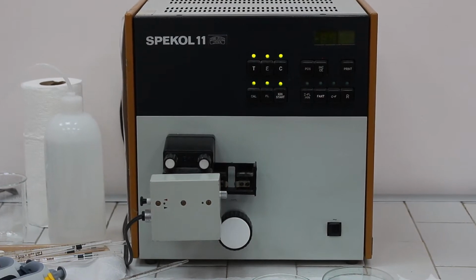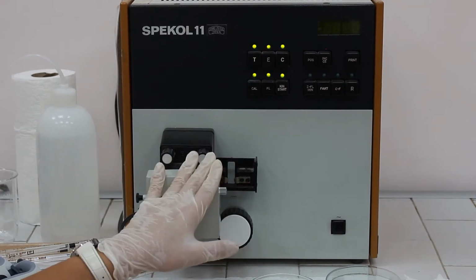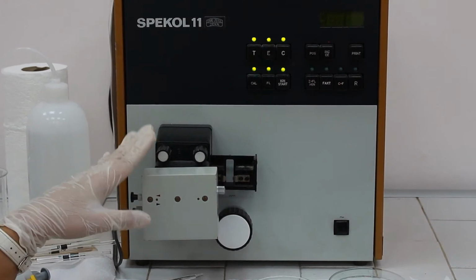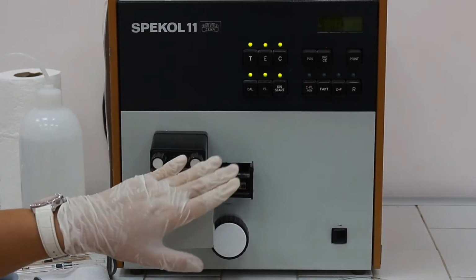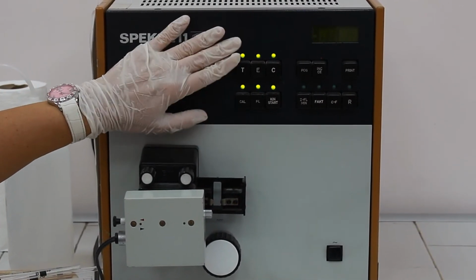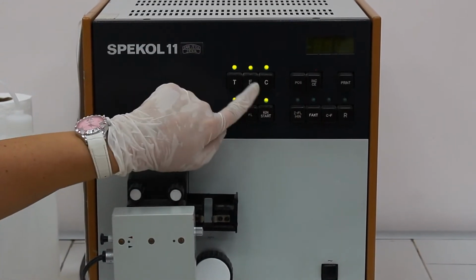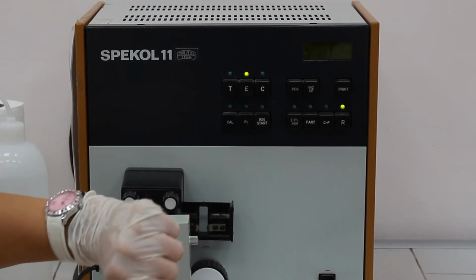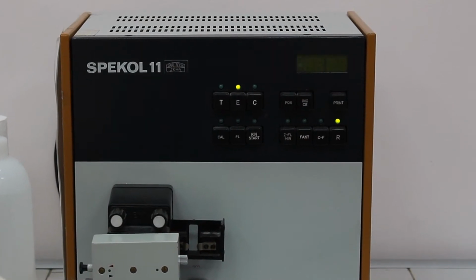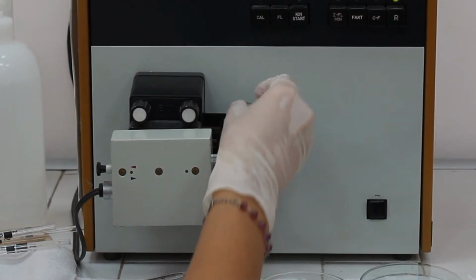So the principle is the same as the normal ordinary visible photometer. It has a lamp, but this time beside the visible lamp we have and need sometimes the UV lamp. Then we have here several buttons. Since we are interested only and exclusively in reading the absorbances, we need to press button E. Then here we have a display at which we are going to read the absorbances and the compartment to which the cuvette is going to be properly placed.